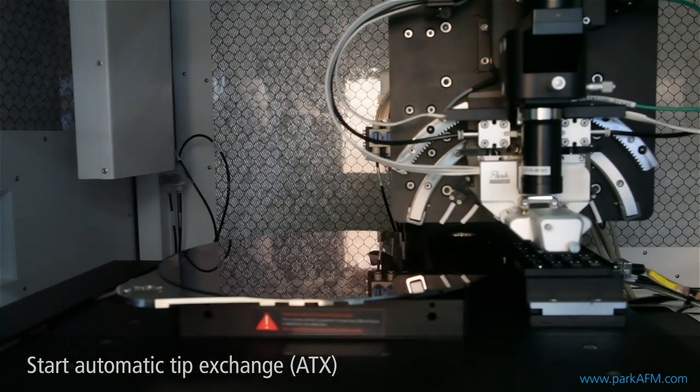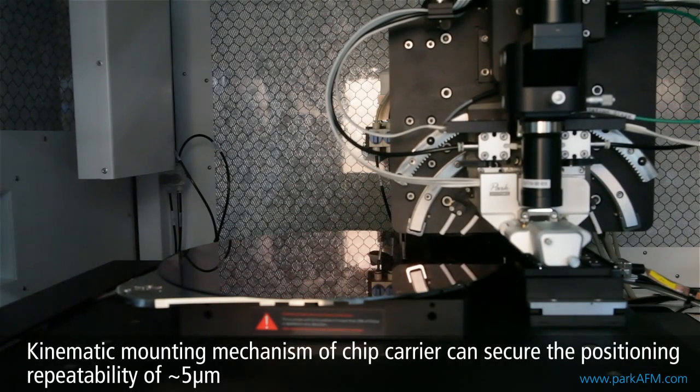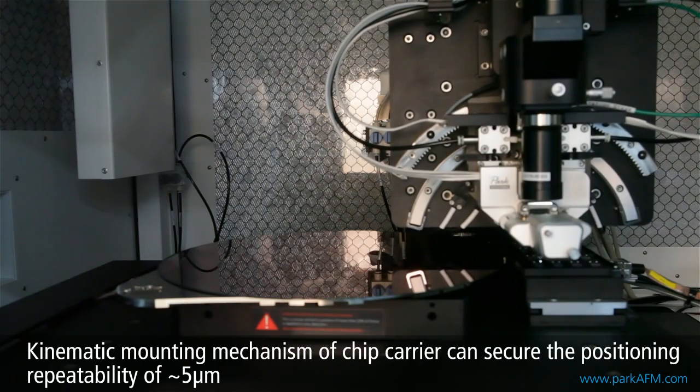Automatic tip exchange is carried out, replacing the tip for sample measurement. A new cantilever from the tip tray is attached and automatically aligned.